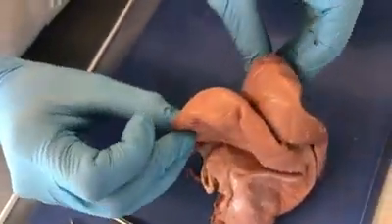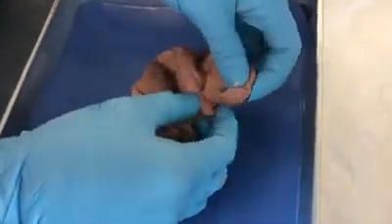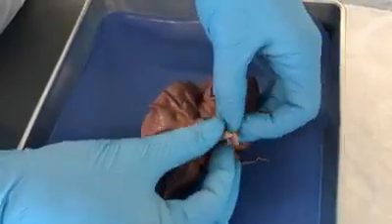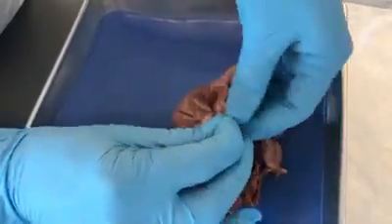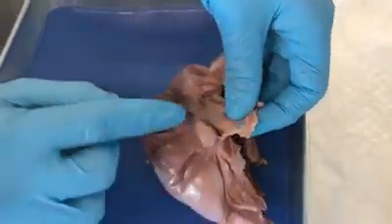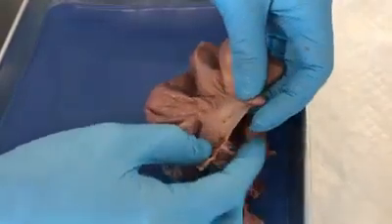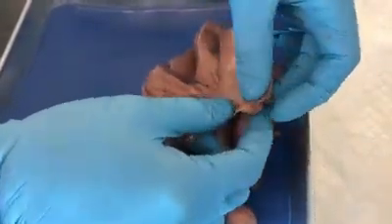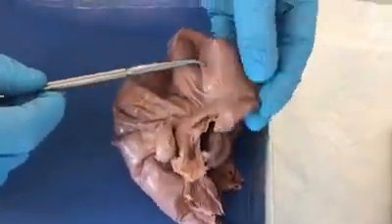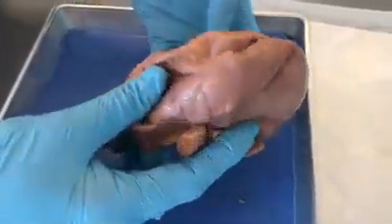There are two uterine horns, and as you follow along the uterine horn, we see that it leads to the fallopian tube, which contains these finger-like projections called fimbriae, and these have an undulatory motion which will allow the collection of the oocyte once the ovulation occurs, and then the oocyte would travel down the fallopian tube, and that is where the fertilization will take place, and then the fertilized embryo would migrate down and it would get implanted in the uterus. So that is the external anatomy of the uterus.